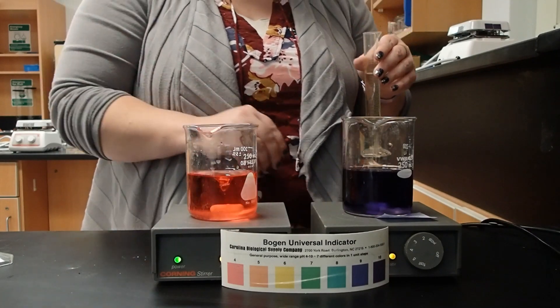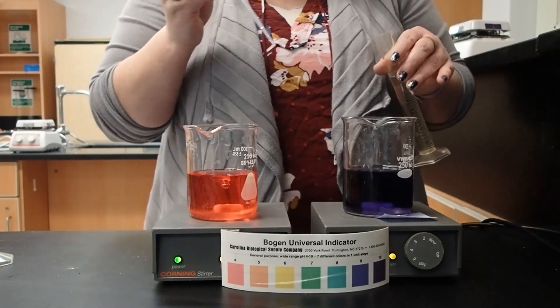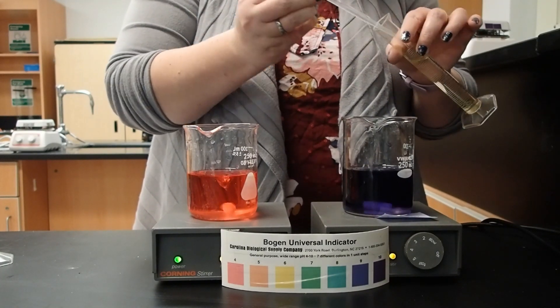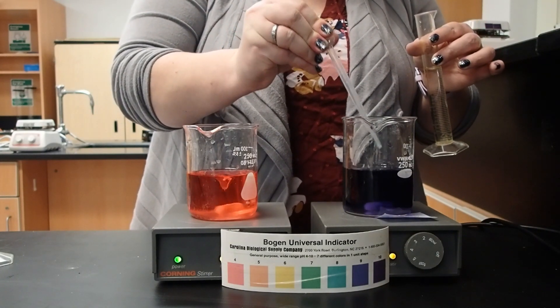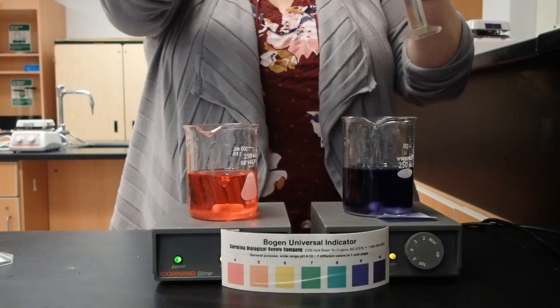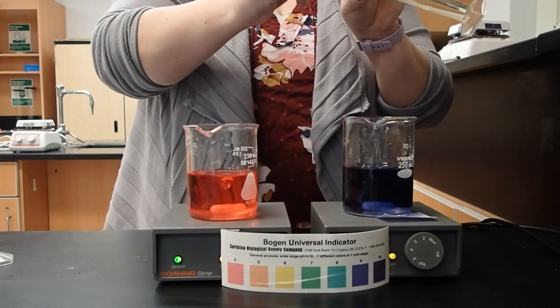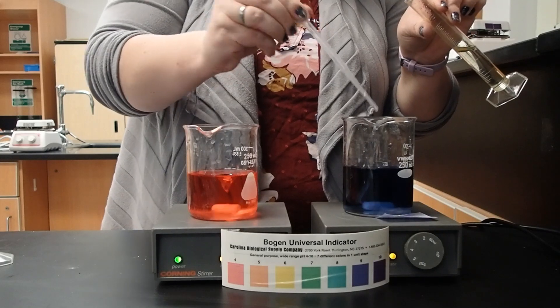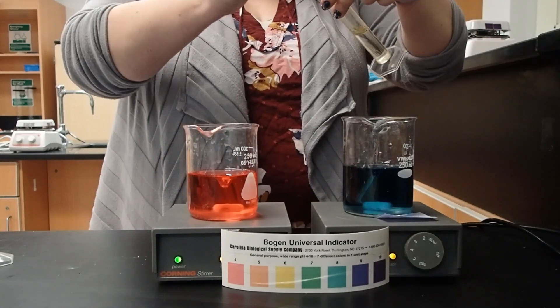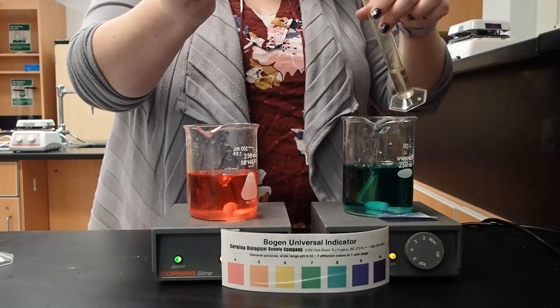I have the same amount of acid, same concentration as before, and I'm going to add it in. Hopefully we'll see a more progressive change as our acid is being buffered by our solution. Our change will be slow overall because we have such a concentration of hydroxide ions — a very basic solution. I've added in about a third of my solution, and you can see maybe it's going a little blue. We are definitely neutralizing our alkaline solution, but our buffer is slowing down that pH change as we go.